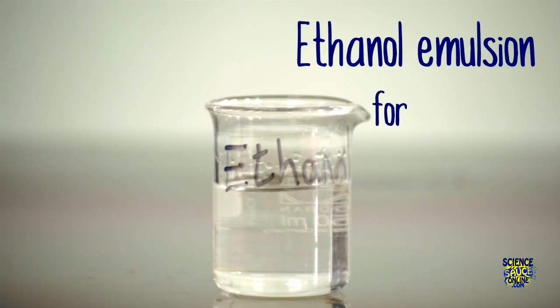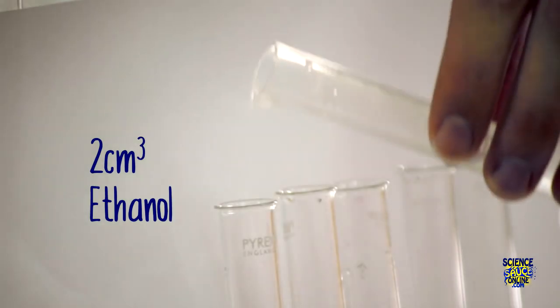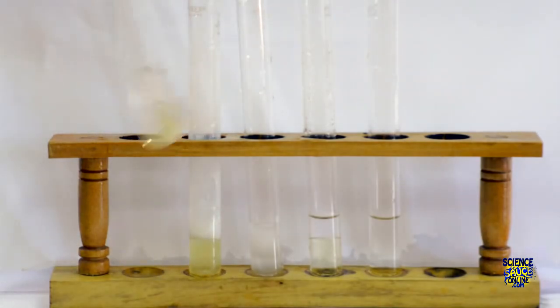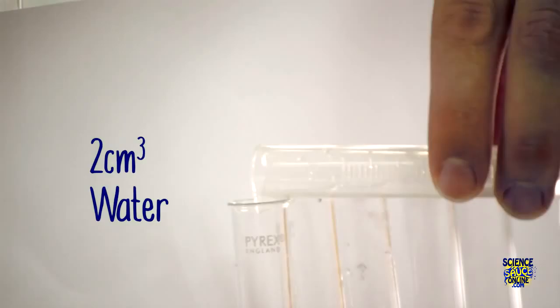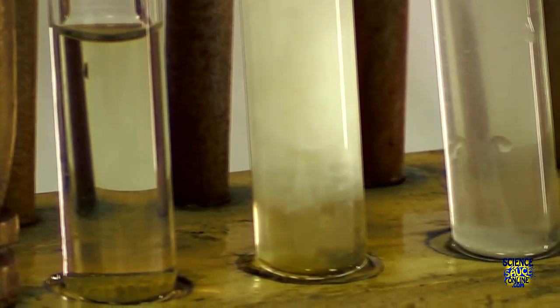The ethanol emulsion test is the test for the presence of fats. First, you need to measure out 2 centimeters cubed of ethanol and pour that into each of your samples. With each one, you need to shake it vigorously. After you've shaken your samples, add 2 centimeters cubed of water and then observe the changes.